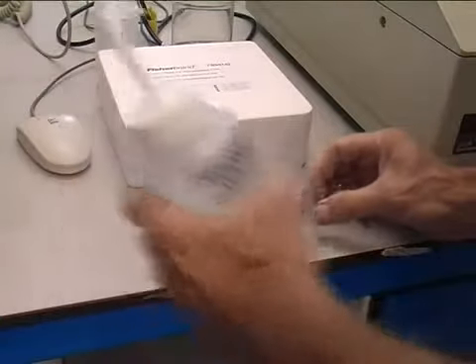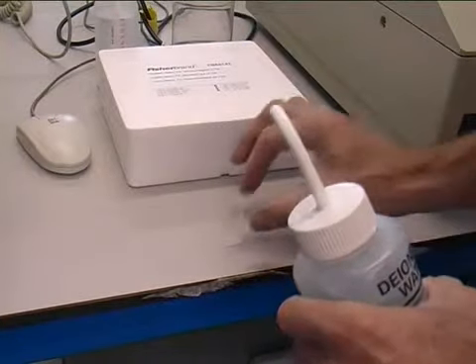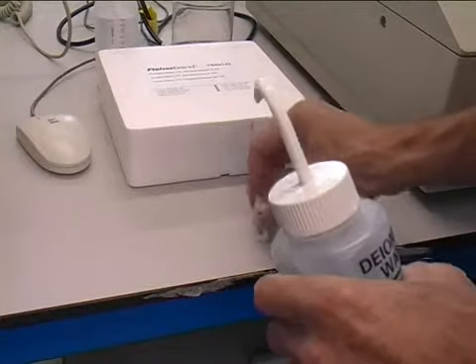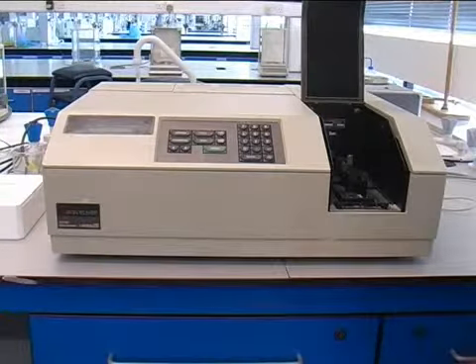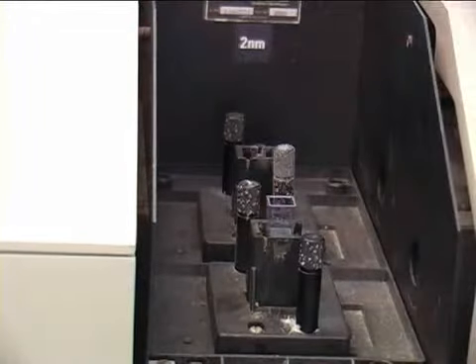First, fill 2 cuvettes with deionized water. This will be used for a reference. It is important to only touch 2 sides of the cuvette, as the other 2 sides must be clear for the beam to pass through. Some cuvettes will have dimples on. That will be the side you handle.